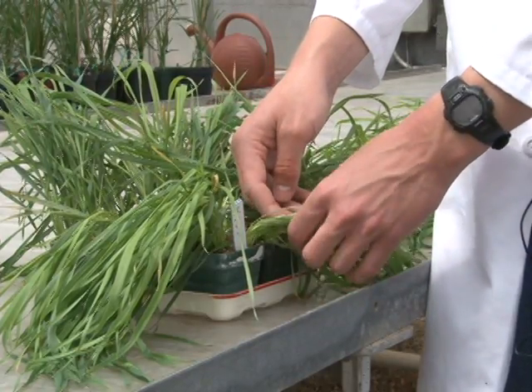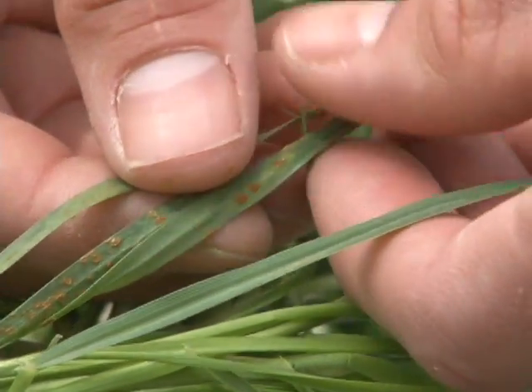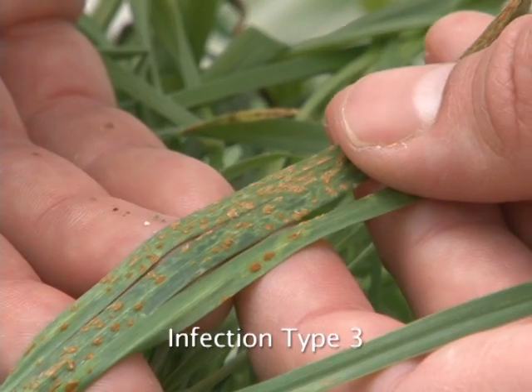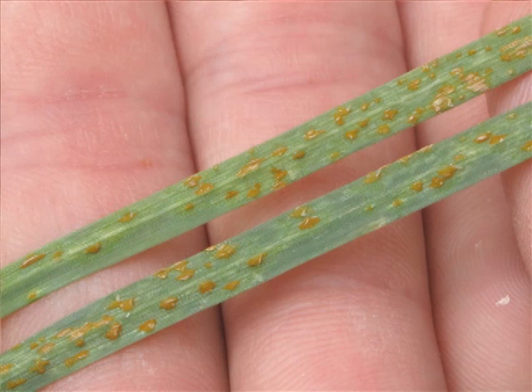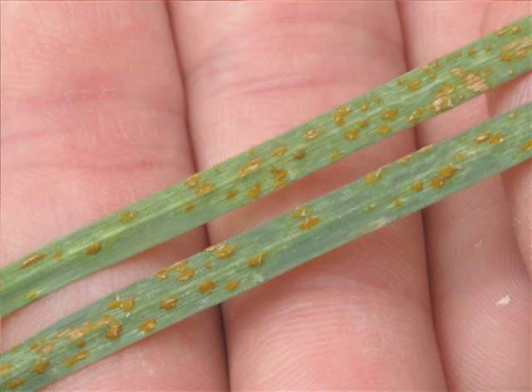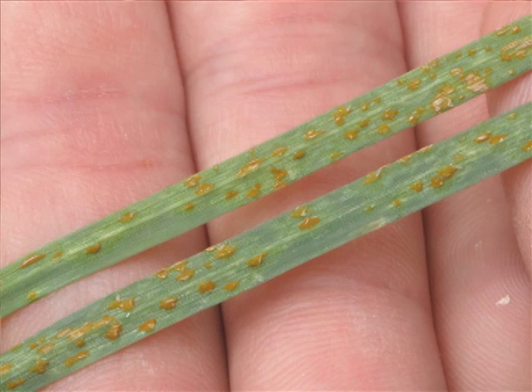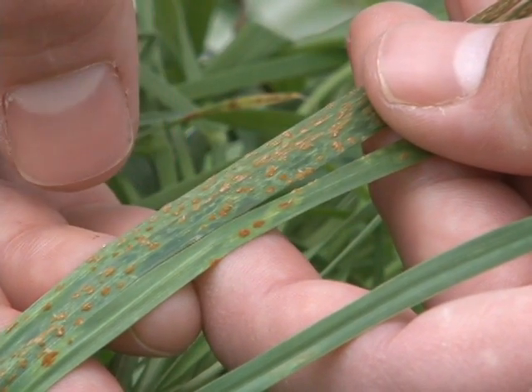This monogenic line has the stem rust resistance gene SR21. When you look at the reaction of QTHJ on SR21, you can see that the infection type is lower than a four but higher than a two. We classify it as a three infection type. The sporulating areas are elongated and diamond shaped, so it's clearly not a two. Also, the green islands aren't as pronounced. The reason it's not a four is because we see a fair amount of chlorosis around the sporulating areas, and the sporulating areas are smaller than what we saw for the four infection type.